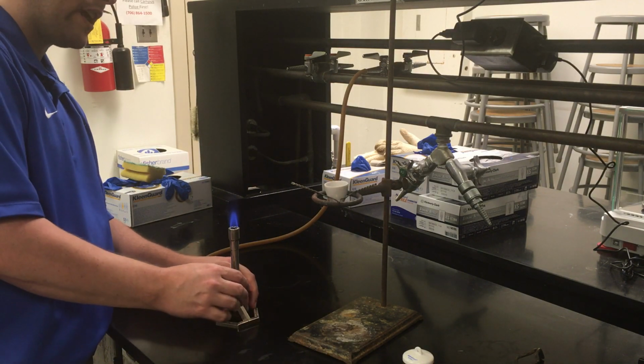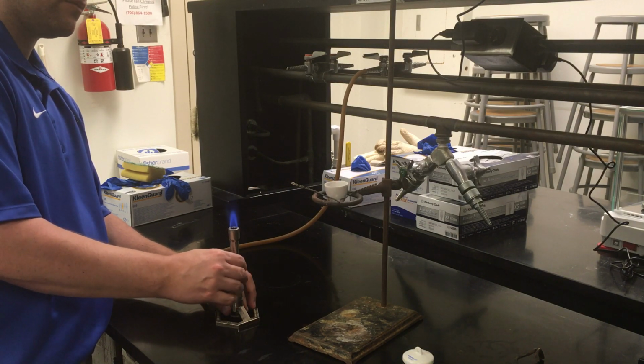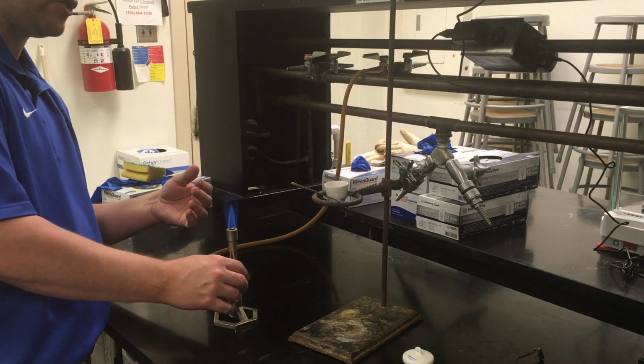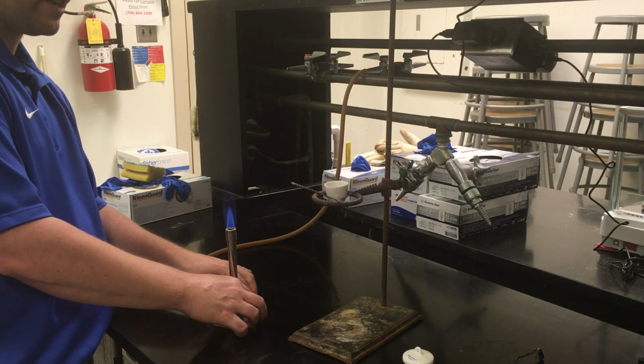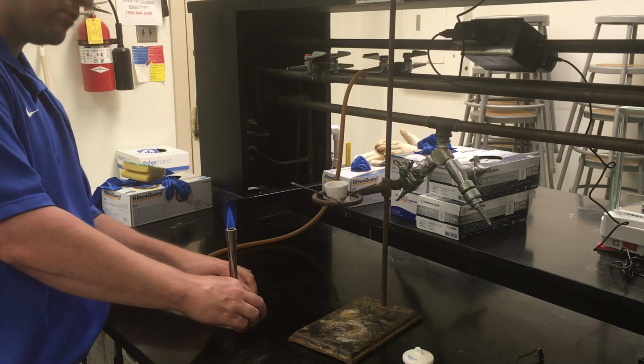And then once you have your flame on, you can actually adjust it a few different ways. The top twists both directions, which adjusts how much air is flowing through, and so you can see it adjust the cone shape a little bit as you're doing that. Or you can adjust the bottom, which is how much gas it has access to, and so you can adjust the flame size that way as well.